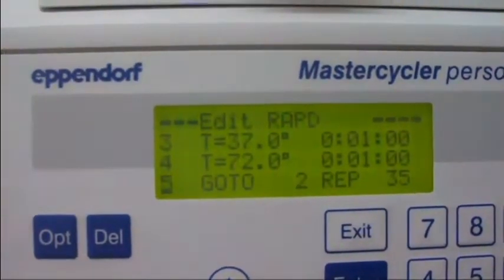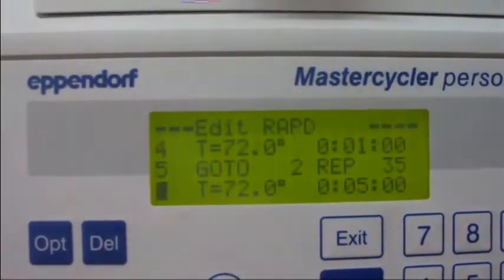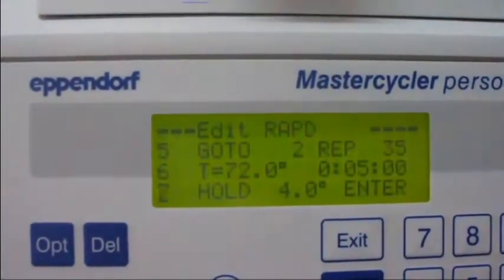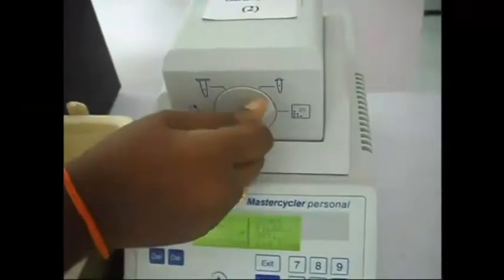The optimum number of cycles is 35. Hold the samples at 4 degrees Celsius after reaction. After the PCR reaction is over, switch off the PCR machine. Unload the samples and place them in ice box. Carry the samples back to lab in ice box.